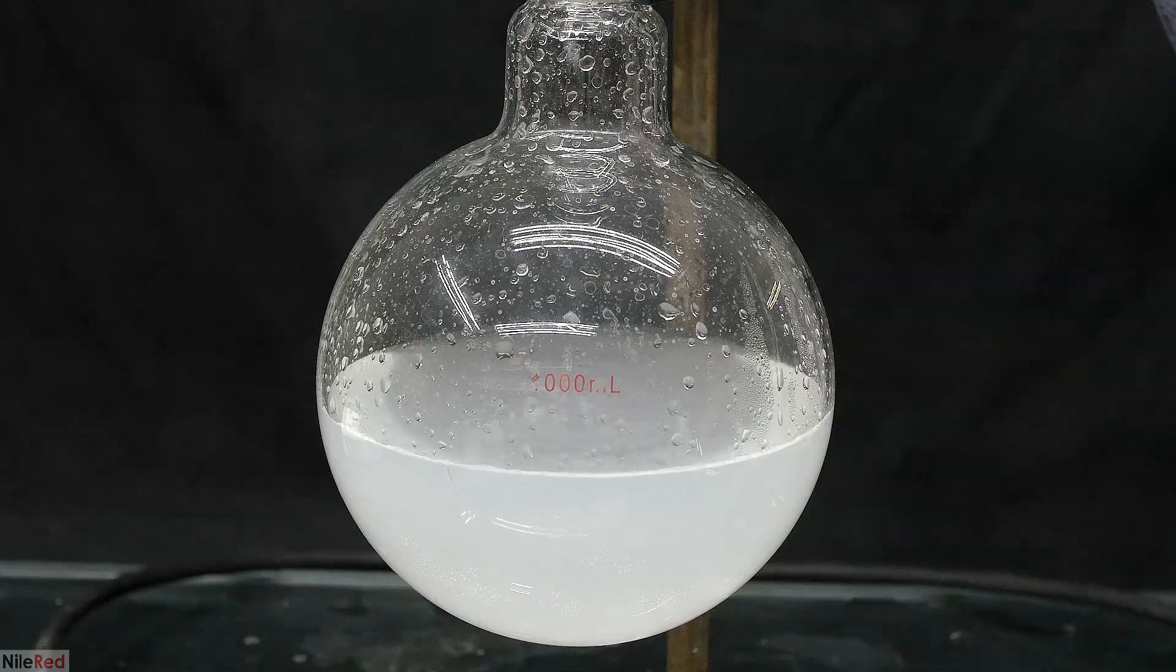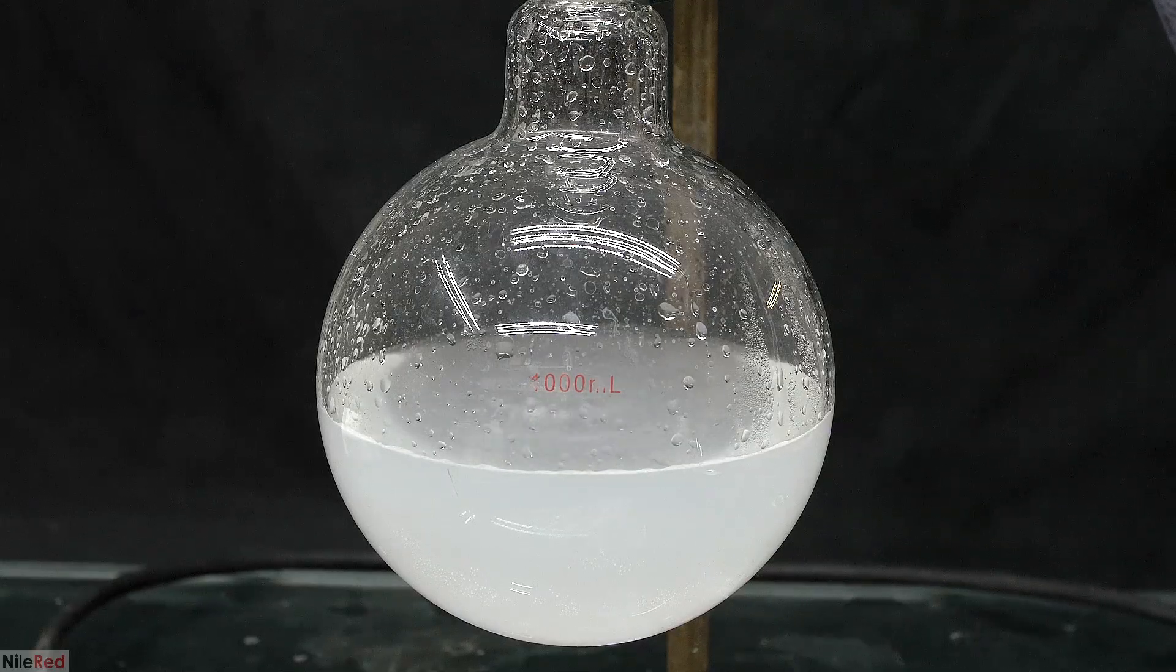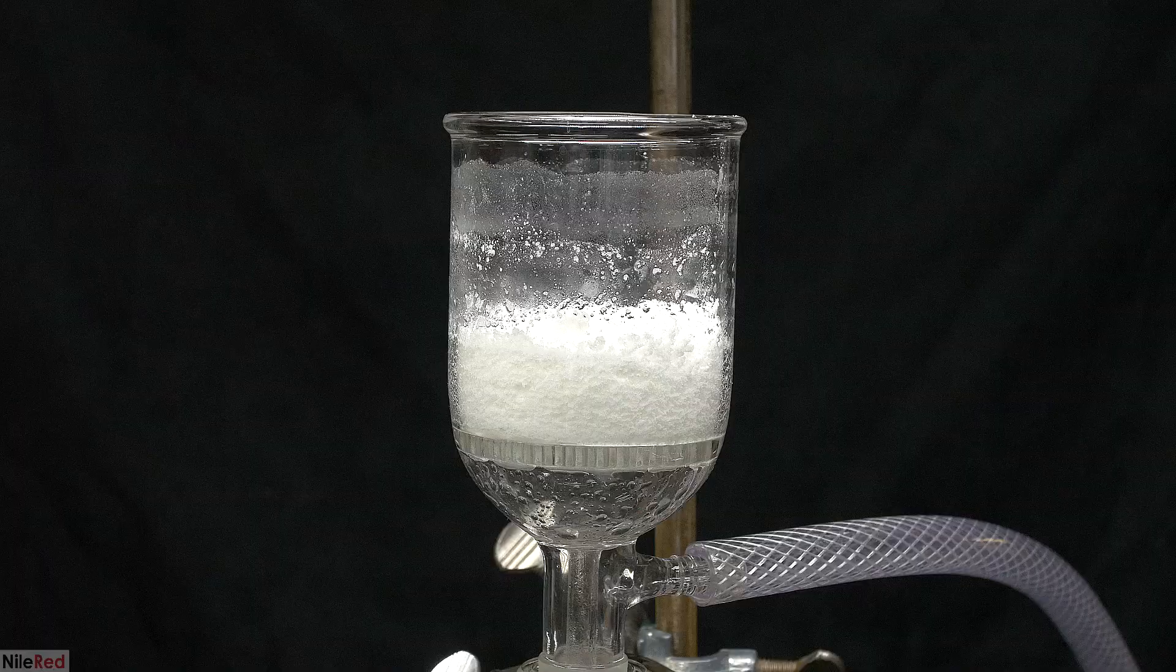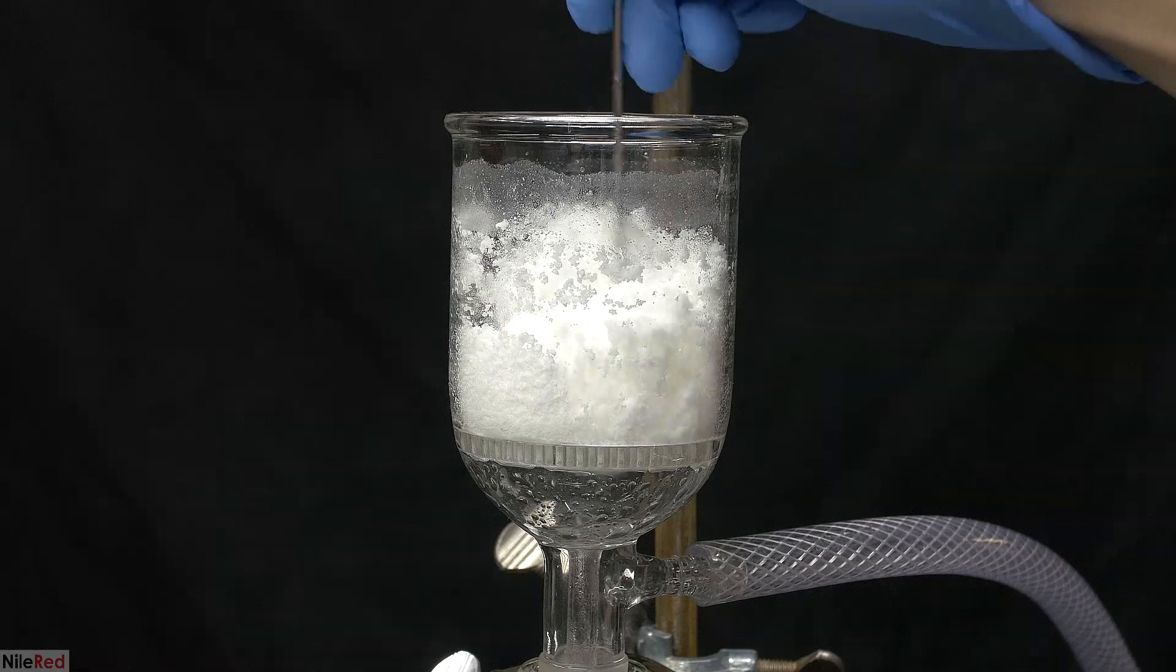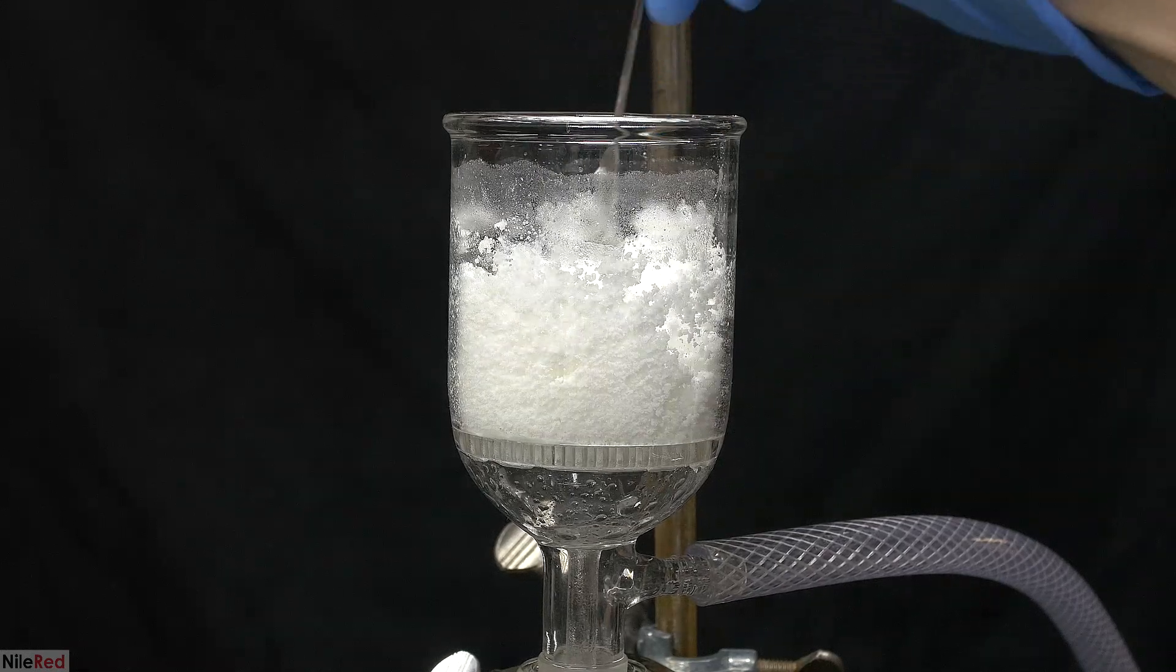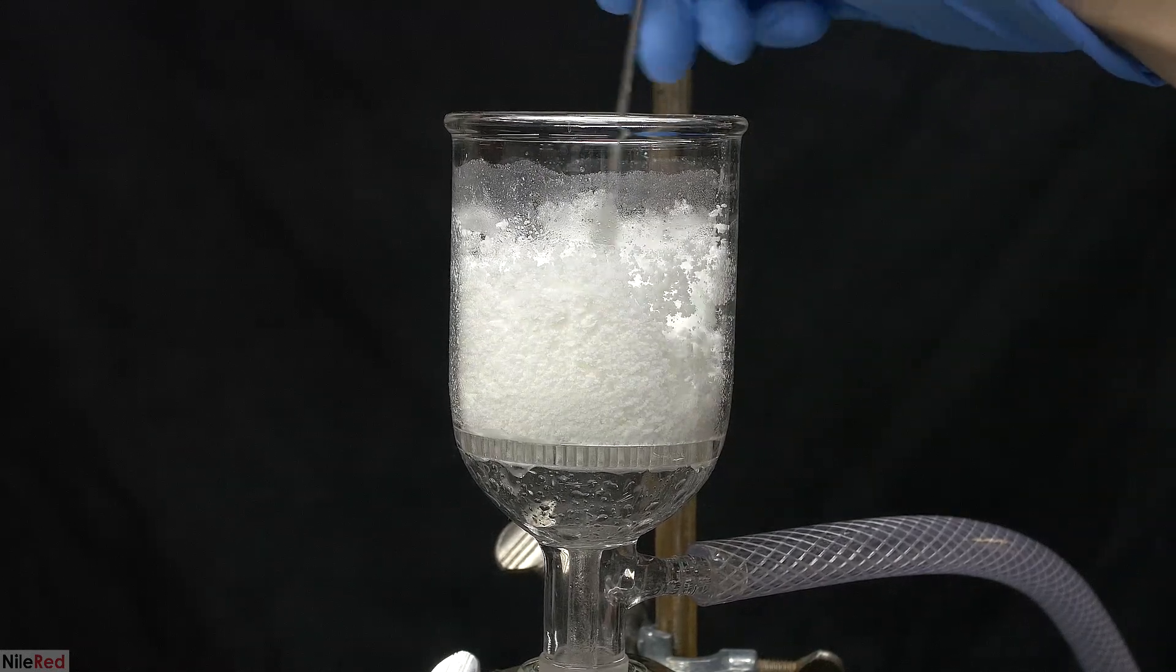Unfortunately, adipic acid is minorly soluble in water, so I have to make sure that I don't overdo the washings. There's definitely some of this impurity still left over, but there's not much I can do. I'm hoping I can purify it out in the next step, when I make adipoyl chloride.